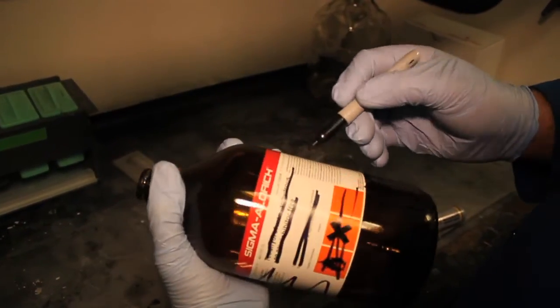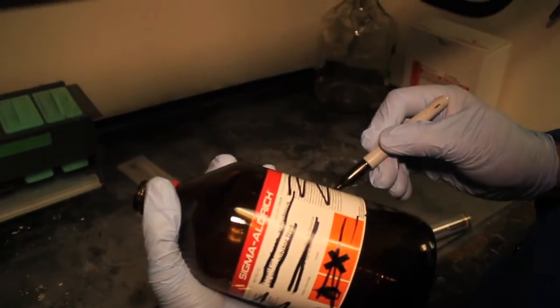Now that the bottle is completely defaced, allow it to dry inside of the fume hood.